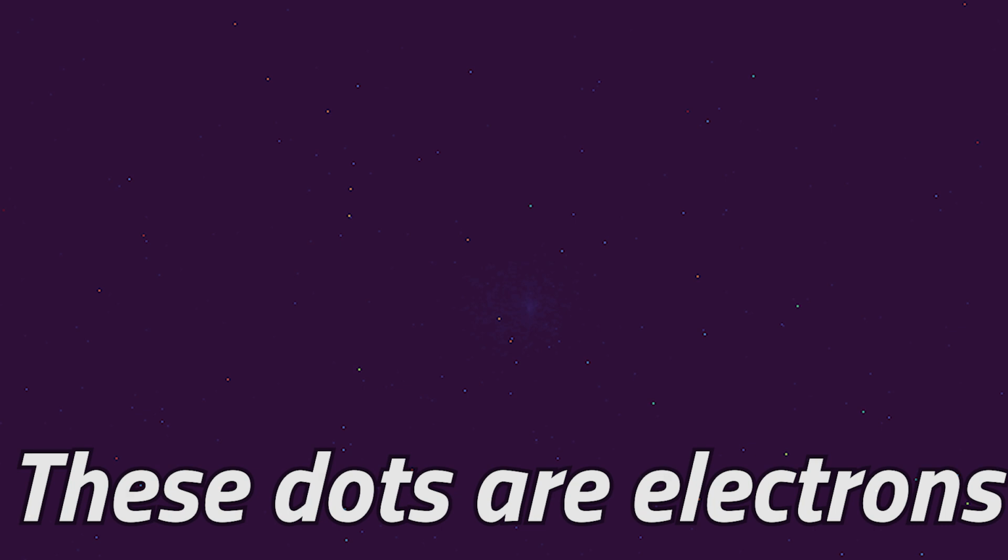That's a bit odd. This is meant to be actually something different, not random garbage. Well, you have to realize that the molecules we put in there are a mixture, and the process of plasma creates even more funky molecules. So this output is the output of all of the different ions combined. We want them separated though. And so that's why we need to figure out a way to separate them somehow.